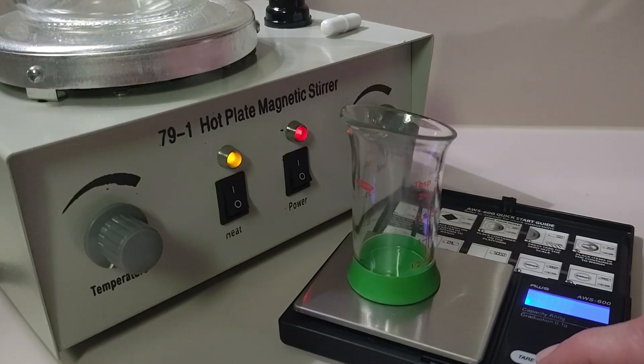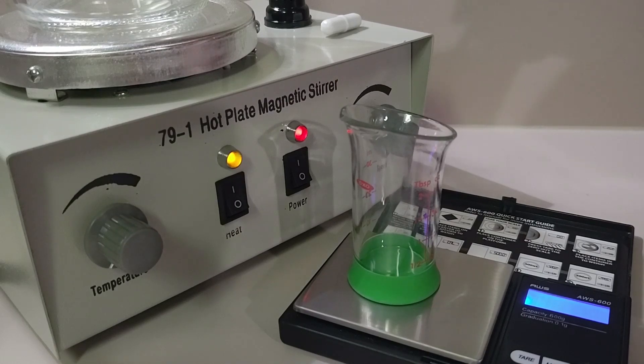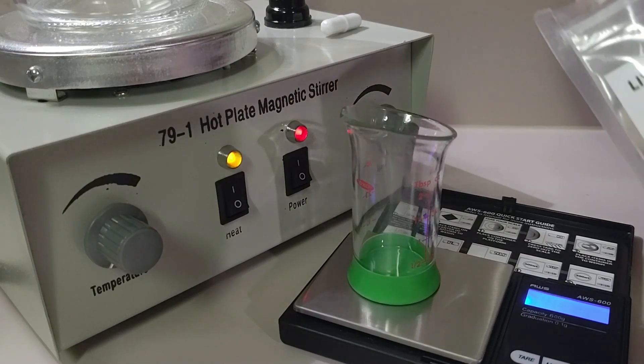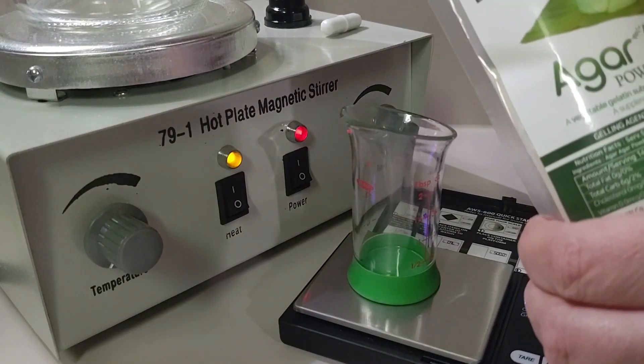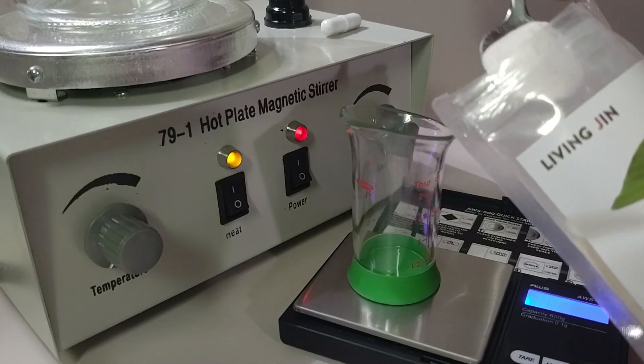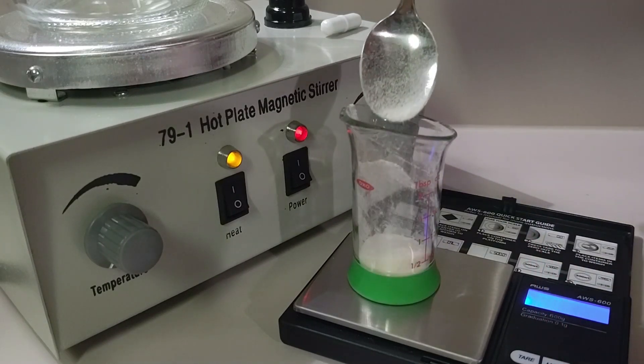In this video we will show you how to make both 500 milliliters and 250 milliliters using only agar and purified water.